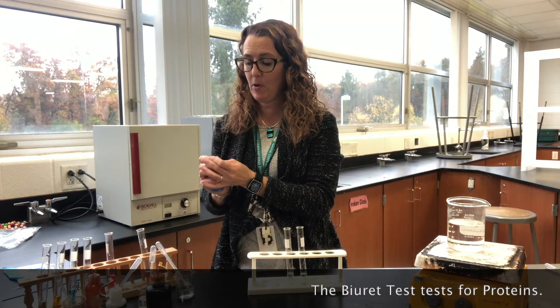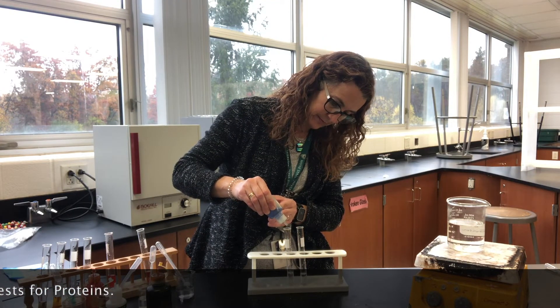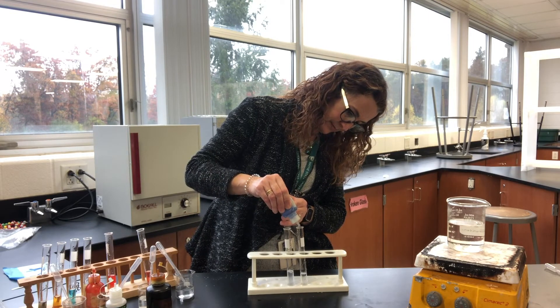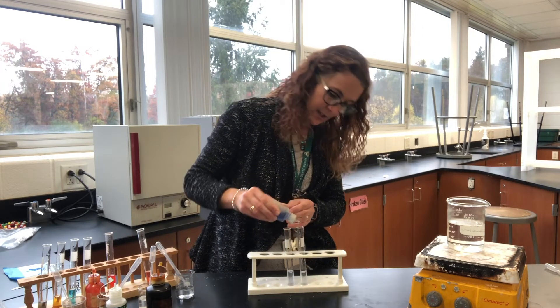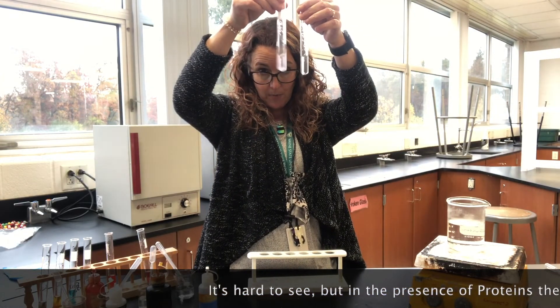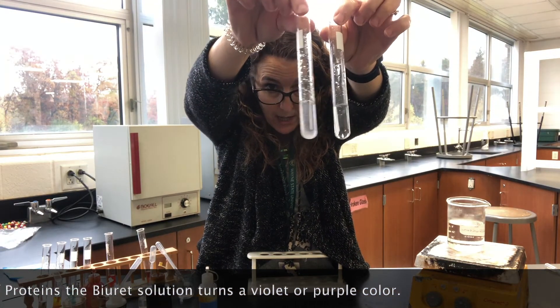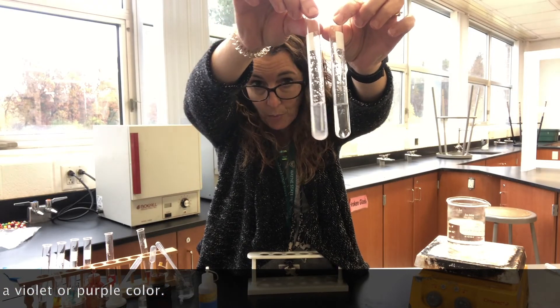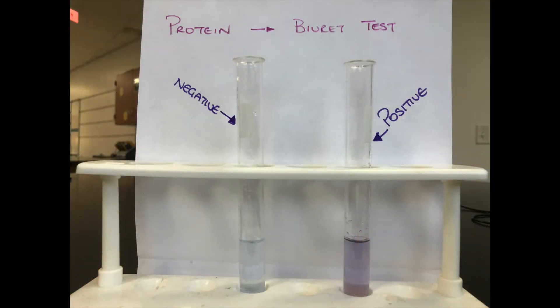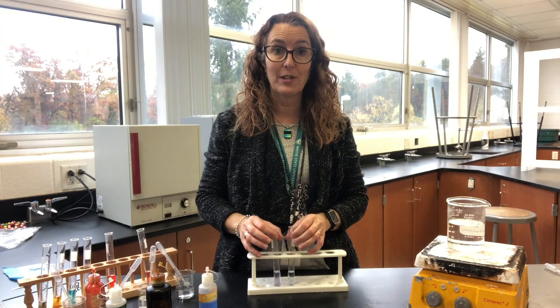I'm going to add my biuret solution, which is blue, similar to the Benedict's but not quite the same. In the protein sample, the biuret solution turns a lilac or purple color — protein goes purple. However, in our water control it just dilutes into a lighter blue. So there you have it — four tests for four different biomolecules.